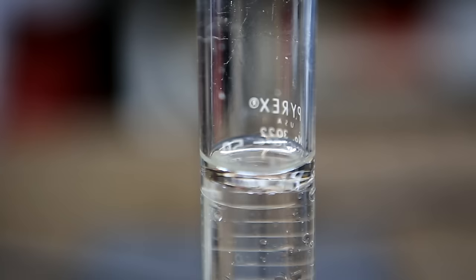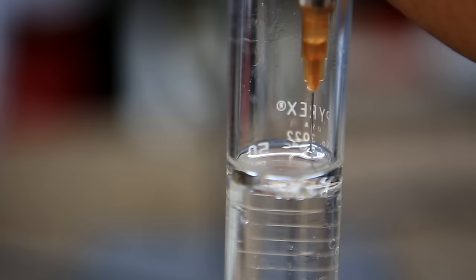Using this method you need to be very careful not to collect any of the water layer and it's honestly probably better just use a separatory funnel.